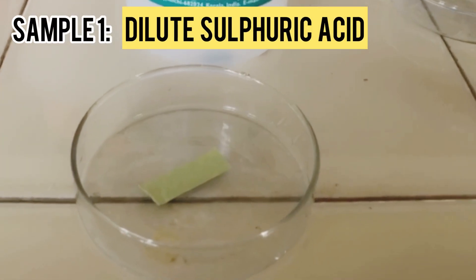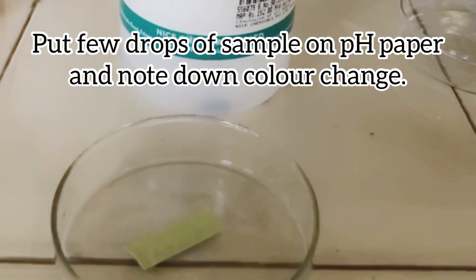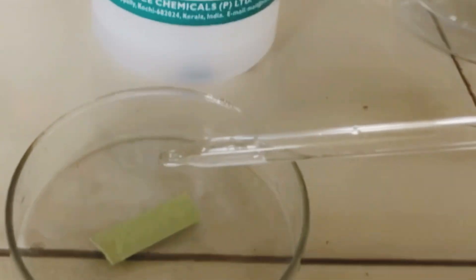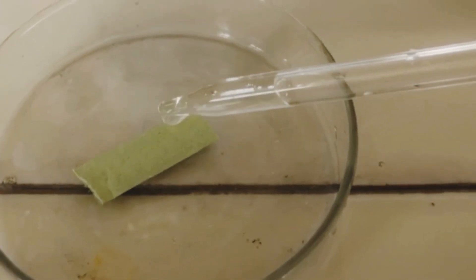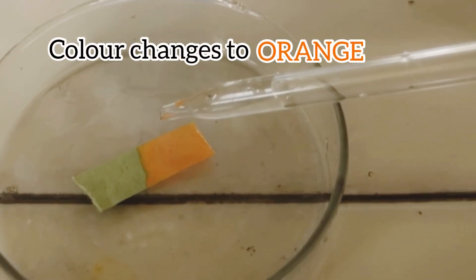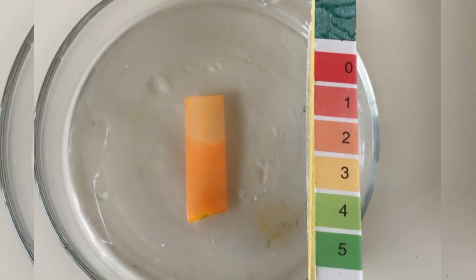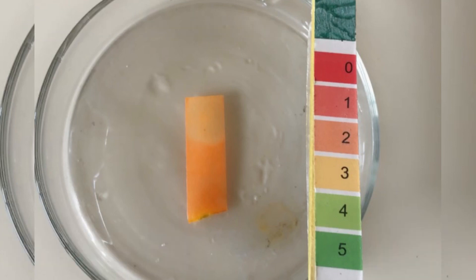Starting with our first sample, dilute sulfuric acid. We just have to put few drops of the sample on the pH paper and note down the color change. The color changes to orange. We compare it to the pH scale and find out the pH. pH is 2.